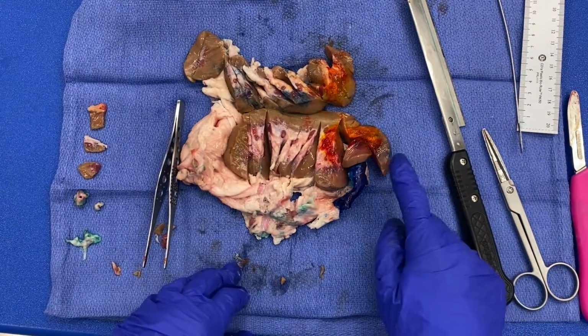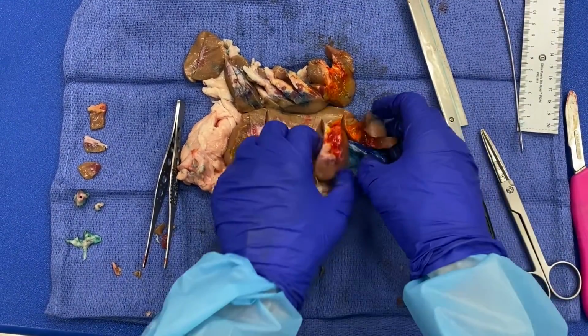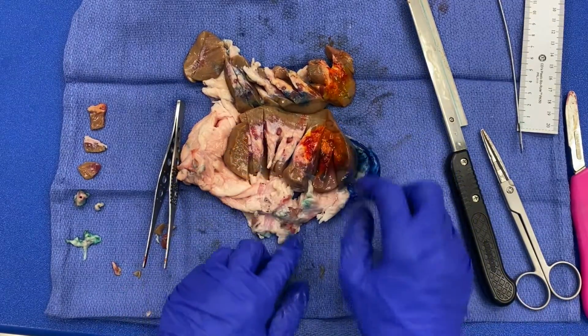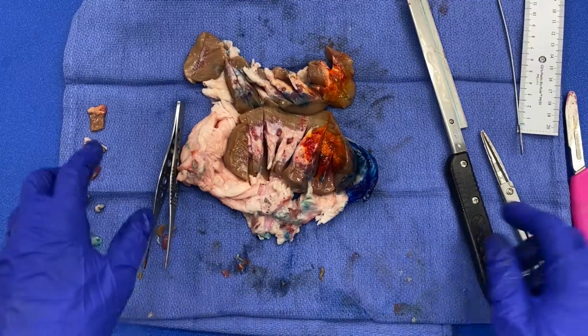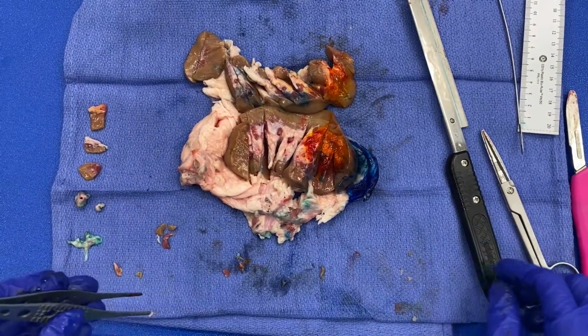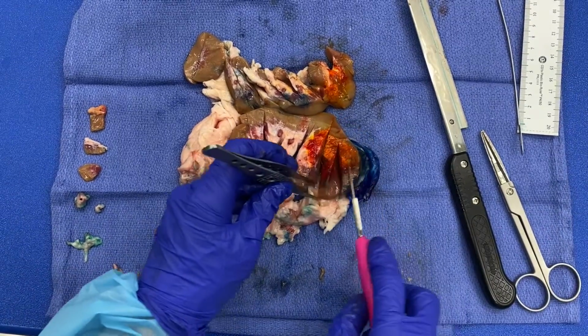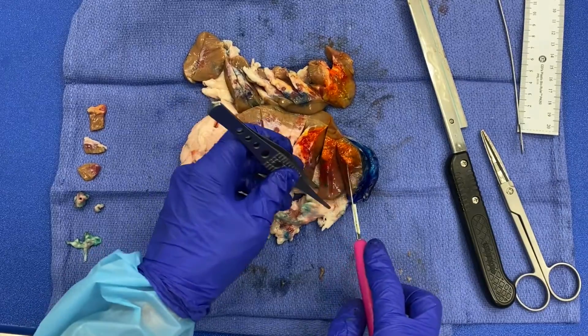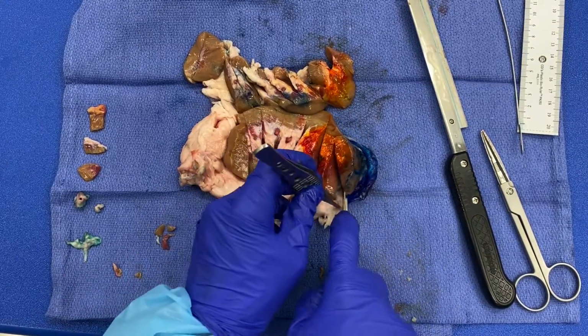So as you can see on this end, it's approaching the capsule. And so what I will do is get my tumor to Gerota's fascia, and then I will get tumor to capsule. So I'm gonna go ahead and we'll say that some of this bleeding ink over here is my mass, right? And then we'll get it in relationship to Gerota's fascia.